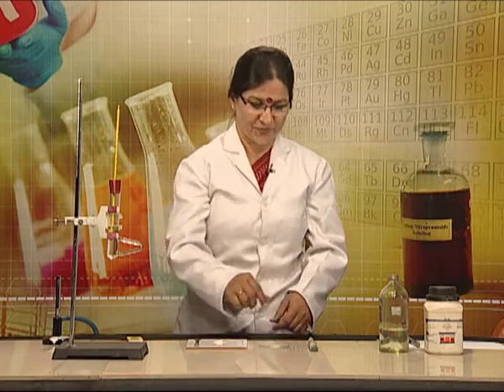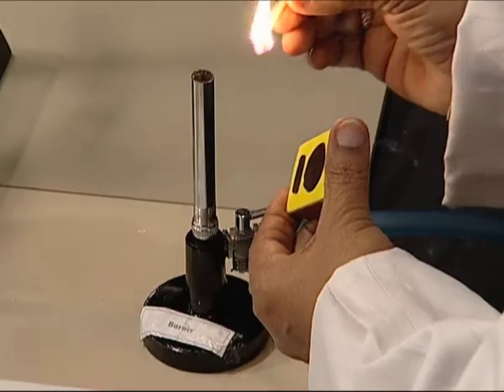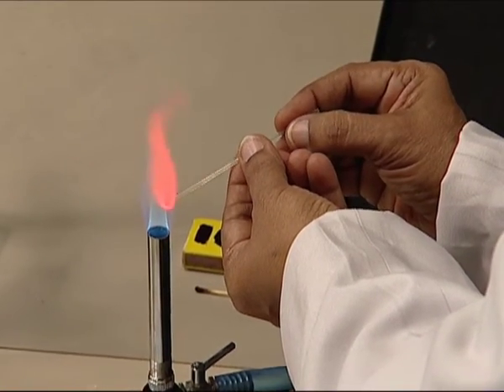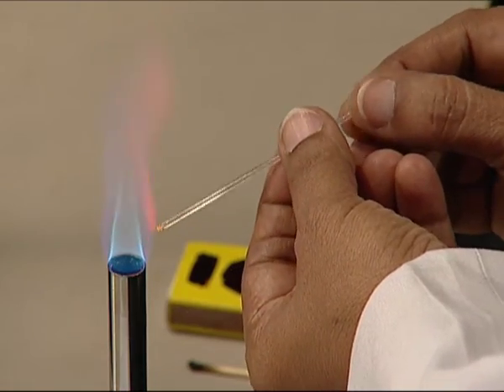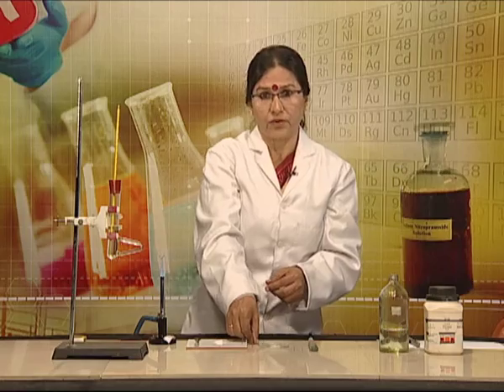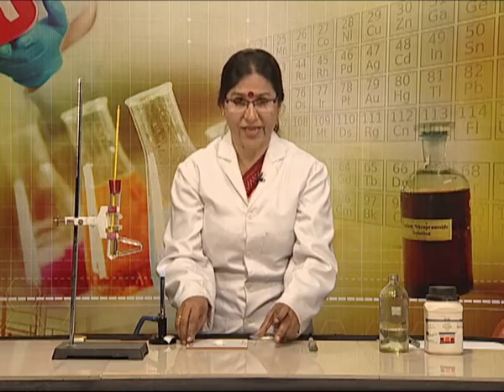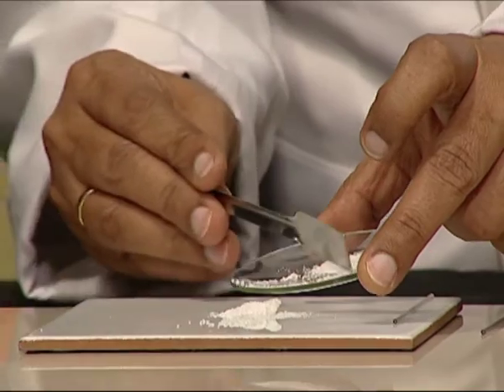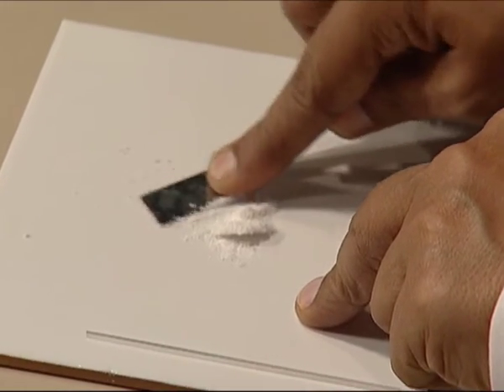We will now take a capillary tube and seal one of its open ends by heating it on a flame. While sealing the tube we should rotate it to ensure complete closure of the opening. After a while, a small bead will form at the sealed end. We will now take finely powdered naphthalene and crush the organic compound into fine powder by pressing it with a spatula on a glaze tile.